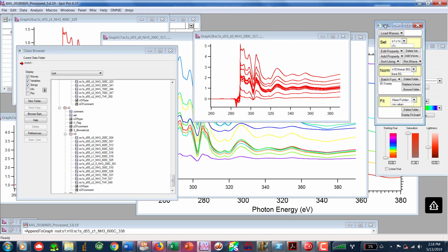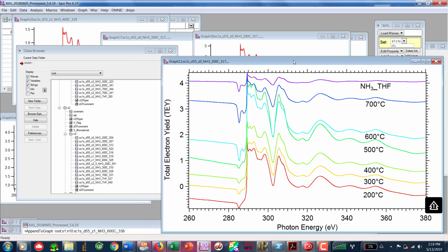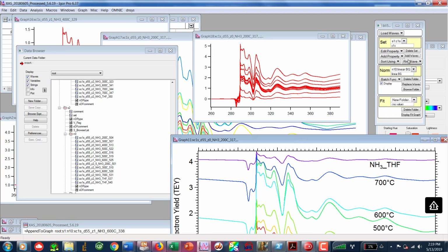Hello, I've been working a little bit on the background subtraction on our XAS data. And Jocelyn, you'll recall that you sent me data that looks like this. And so it looks like you had interpolated it properly, but we have some issues with getting the background subtraction going. So I just did a background subtraction, and the ending data looks like this.